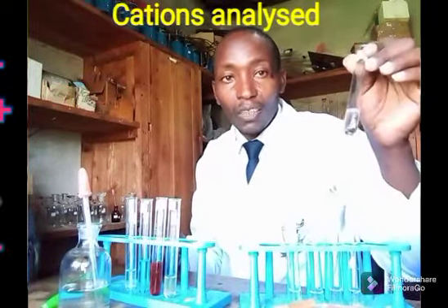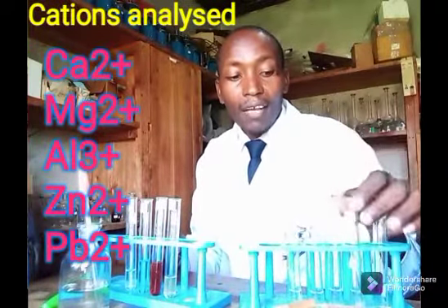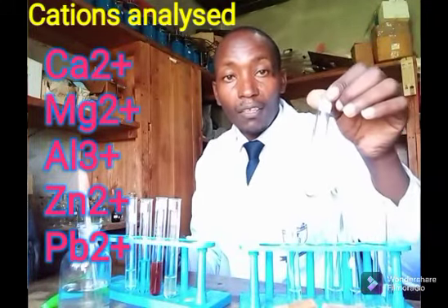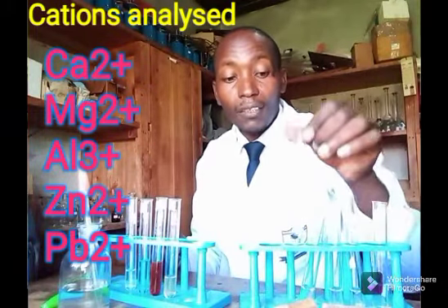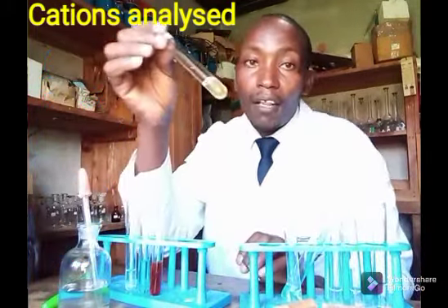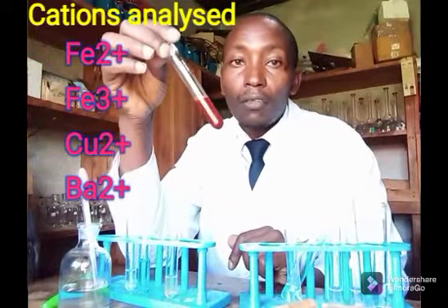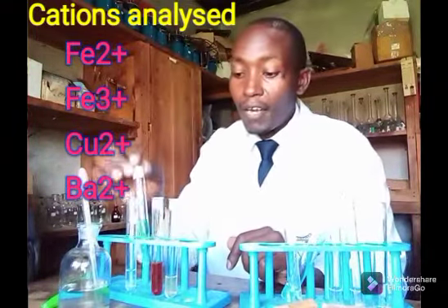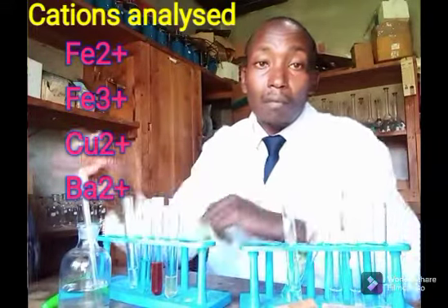So again, I have a solution containing calcium ions. I have another one with magnesium ions. I have another one with aluminium. And then I'm working with another one, zinc ions in solution. The other one has lead-2 ions. On the other side, I have another one with iron 2 ions, another one with iron 3 ions. Then I have another one with copper, and finally I will add sodium hydroxide to a solution containing barium.